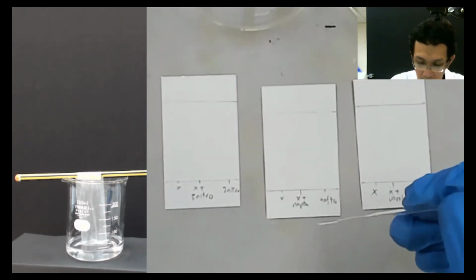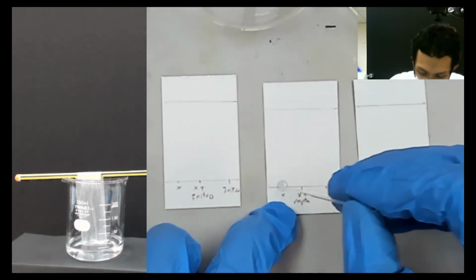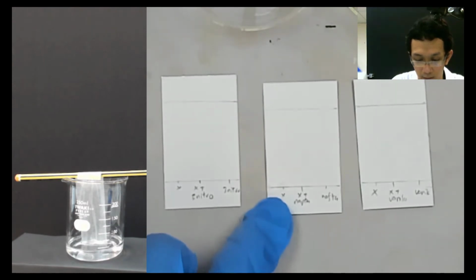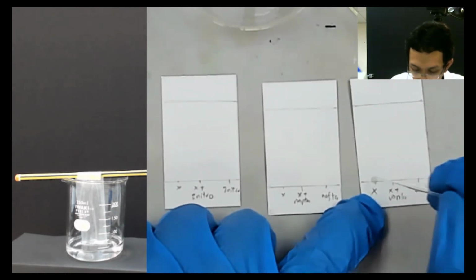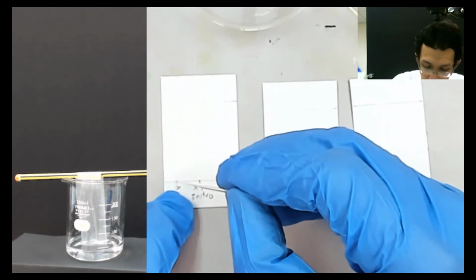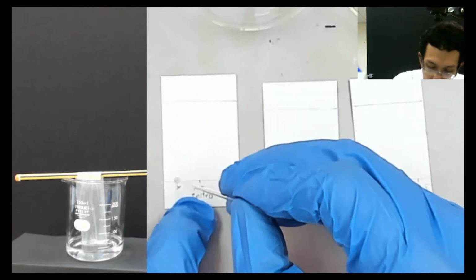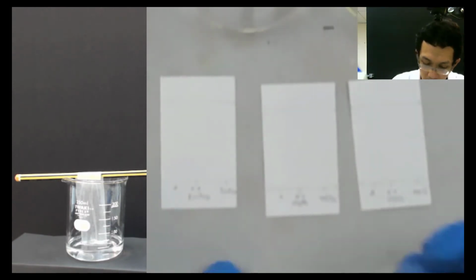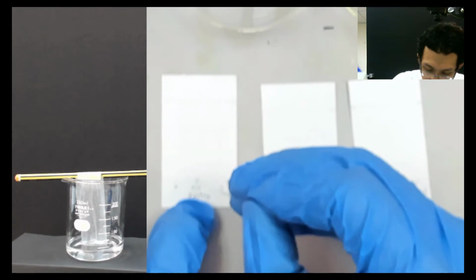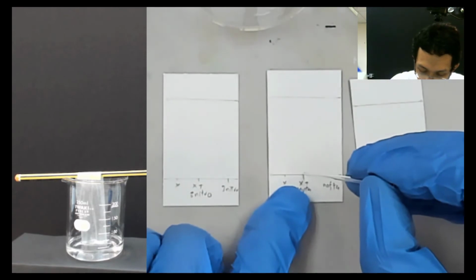Just put a little bit. Oh, that's too big. This one is too big, but it's okay. Also, because the middle one is also X, we can put it straight away in the middle. In the middle, you can also put the X straight there. X in the middle.